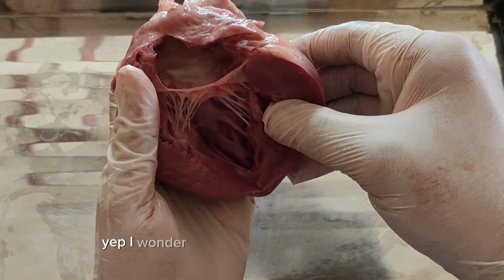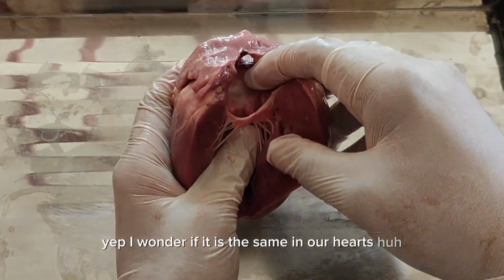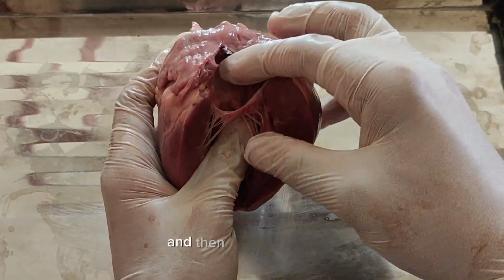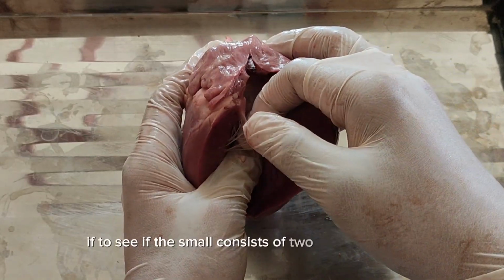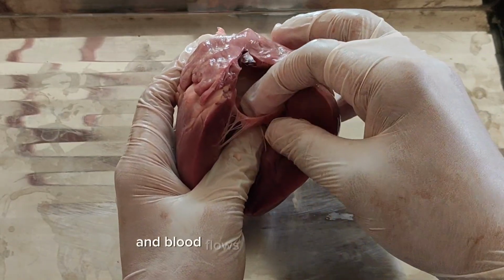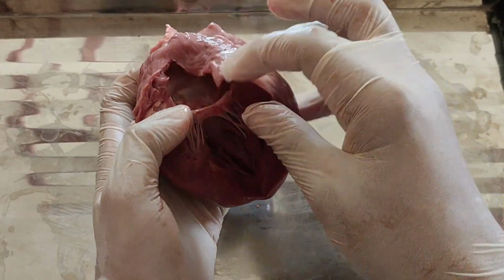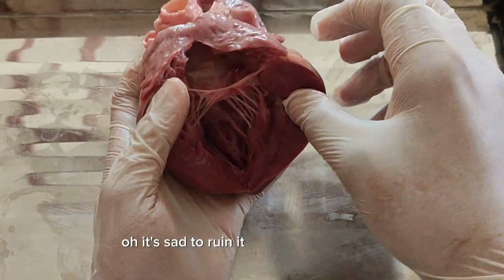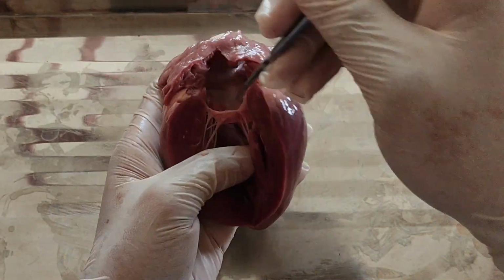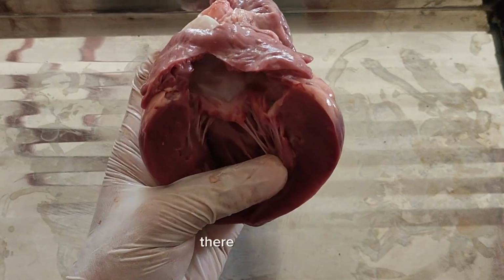I wonder if it is the same on our hearts. Then let us cut it open to see if this valve consists of two leaflets, and blood flows from the left atrium into the left ventricle during diastole. It's sad to ruin it. Okay, let's cut it open. There we have it.